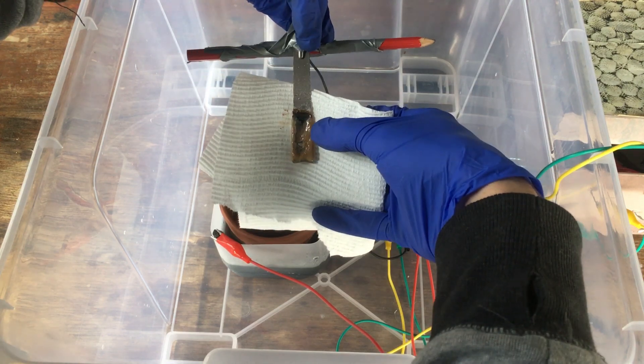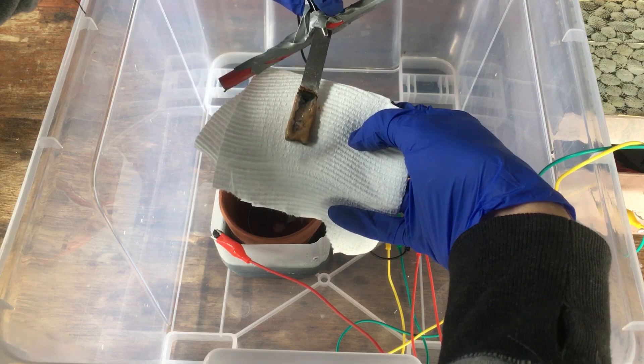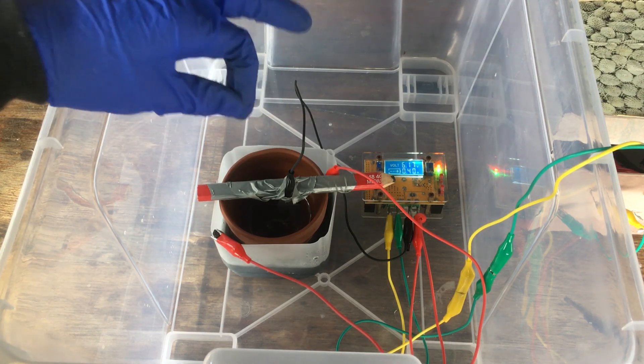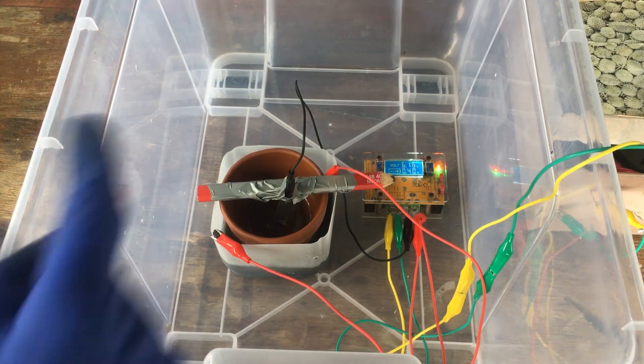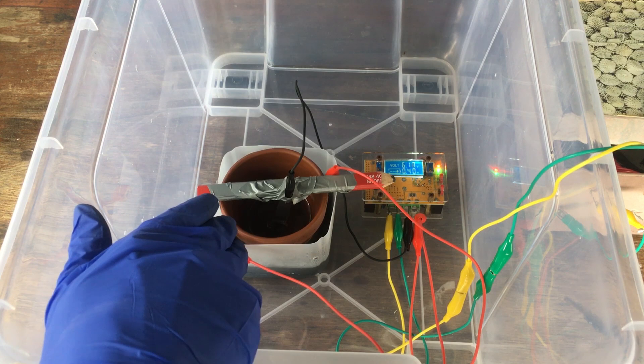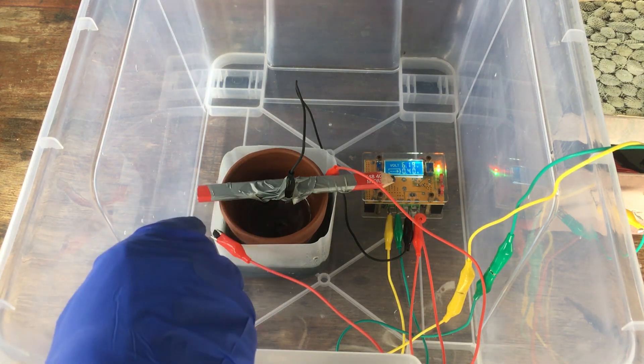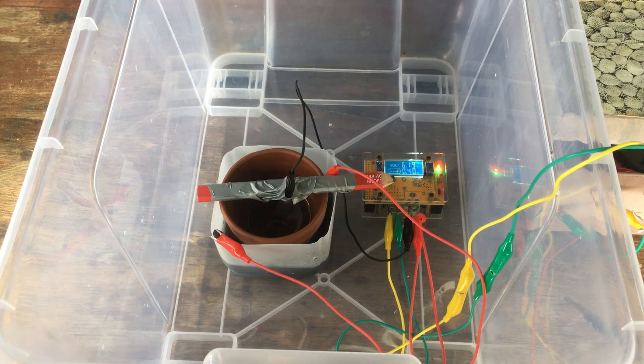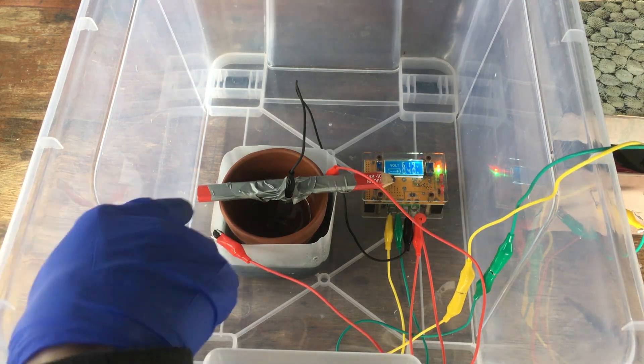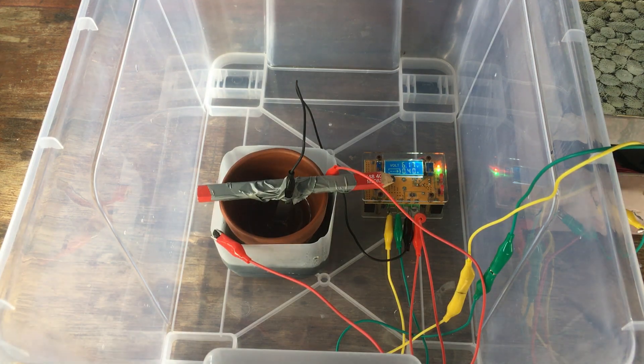You can see a little bit of manganese underneath right at the top, but running the cell for a long time just seems to make this manganese hydroxide, which ruins the whole thing. So it seems like the simple conditions that we want to run our cell at just aren't good enough to get a good thick coating of manganese onto our titanium. The best results I got were having the cell at a very mildly acidic state, so that the manganese could actually plate onto the cathode without forming the manganese hydroxide, but very quickly, because of the hydroxide that forms on the cathode, it turns neutral and starts to generate manganese hydroxide. So I'd either have to drop-wise add acid every hour or so, which is very tricky. I mean, if we're running this cell for 48 hours, I need to sleep. I can't just sit here for the whole 48 hours of running the cell and add acid every hour.